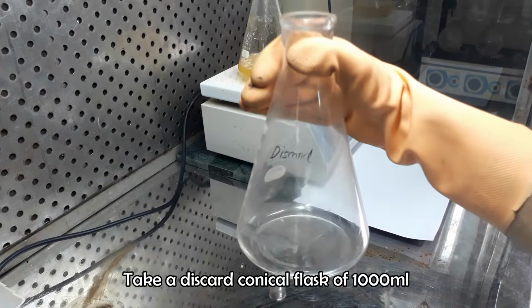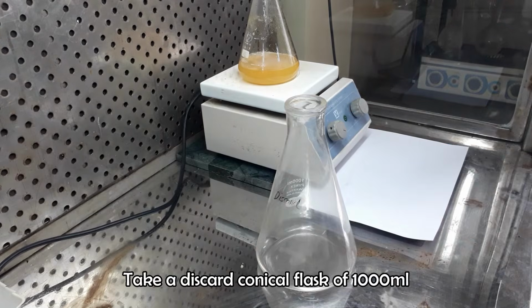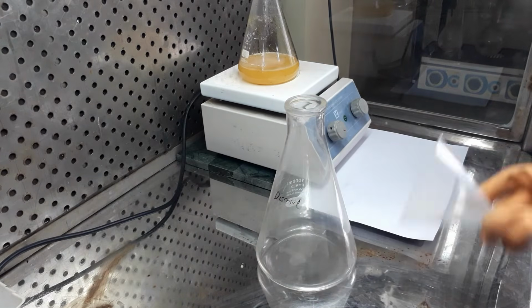After 30 minutes of boiling, arrange a discard system and filter the boiled sample using a cotton cloth and funnel.